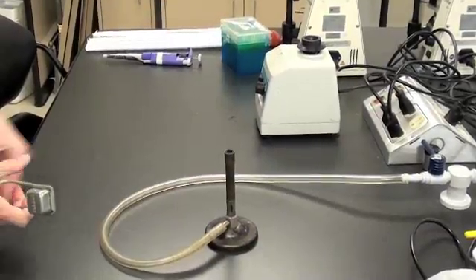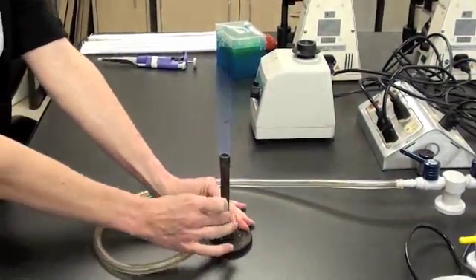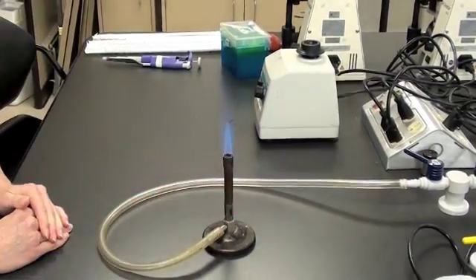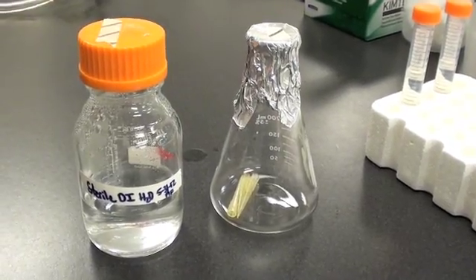Lighting the Bunsen burner creates an updraft across our clean surface. This reduces the chance that microorganisms from the environment will fall into our workspace. Now we're ready to aseptically transfer liquids from one vessel to another.